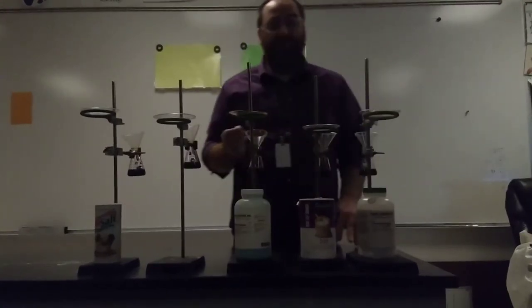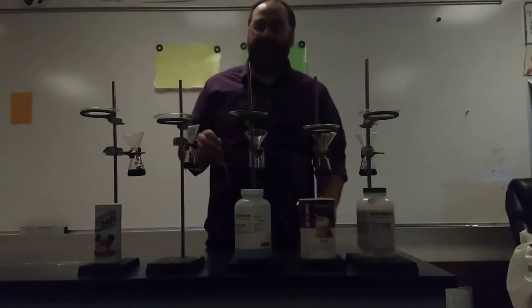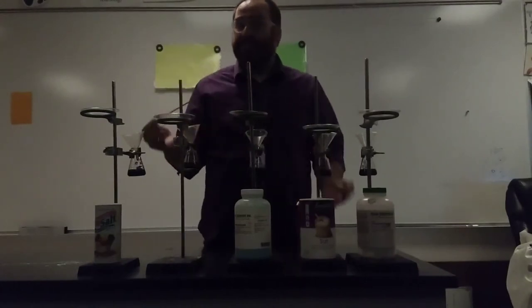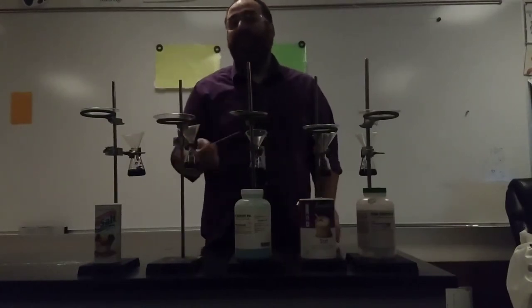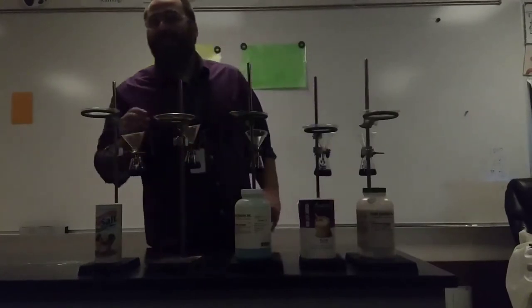This one is copper chloride, that's one copper and two chlorines attached. Right here I don't have any substance, there's no substance to create a color that I would like, so we're just going to call this one our control.